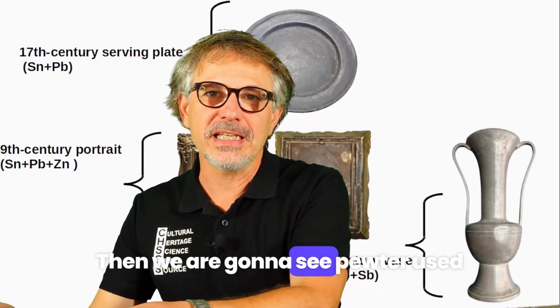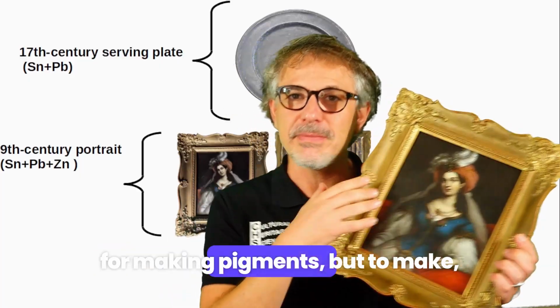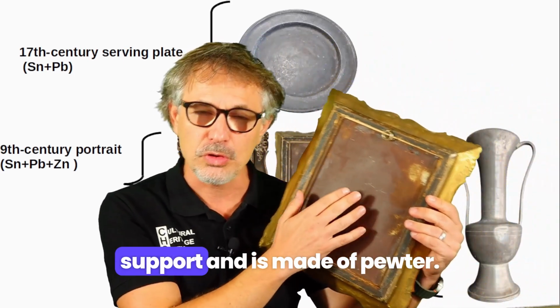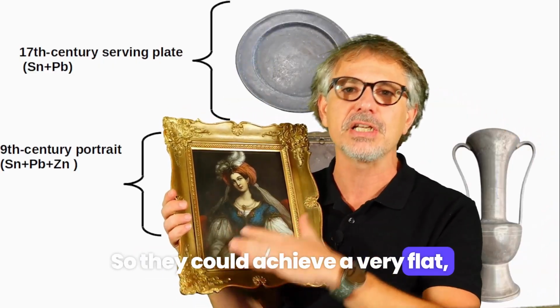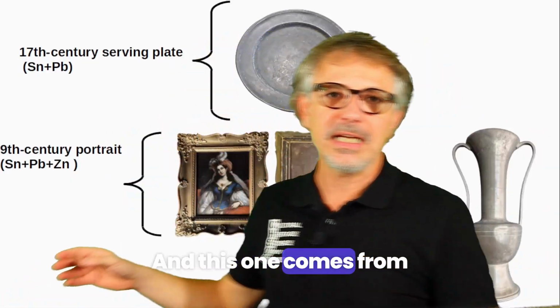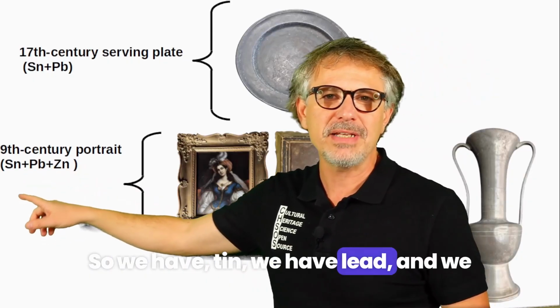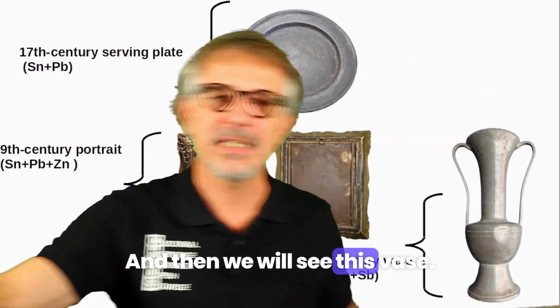Then we are going to see pewter used in painting, not for making pigments, but to make the back of the painting. So indeed this one is a metal support and is made of pewter. So they could achieve a very flat, smooth surface to make the details. And this one comes from the 19th century, so we have tin, we have lead, and we have also a tiny bit of zinc. And then we will see this vase.